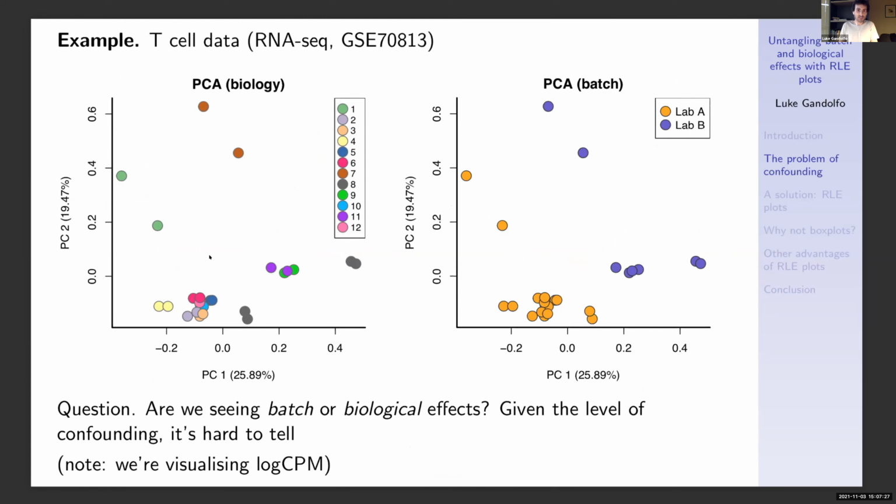These 2 brown samples, these 2 purple samples, these 2 bright green samples, and these 2 gray samples, they are all sitting in the purple batch over here. And all the other samples are in the orange batch. And again, the question is, are we seeing batch or biological effects here? Given the very high level of confounding, it's very hard to tell from the PCA plot. And I'll just note that we're visualizing log CPM here, so library sizes are being taken into account.